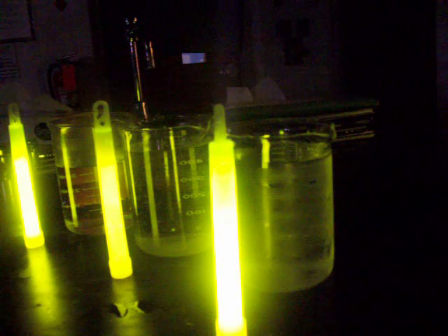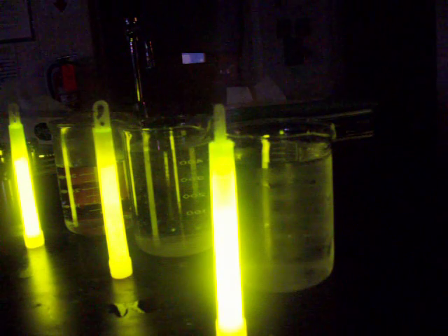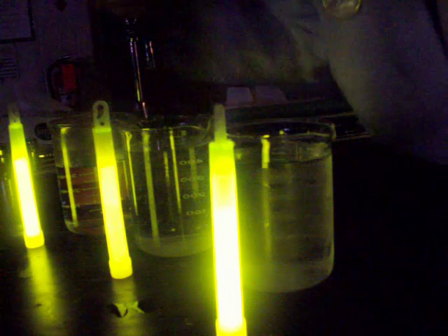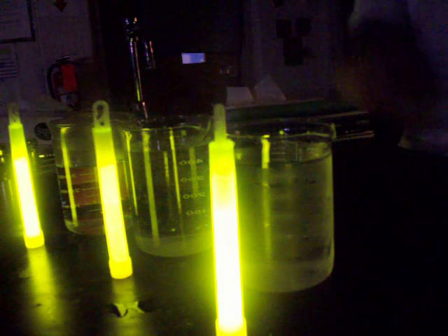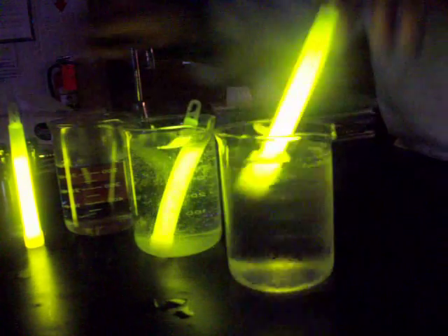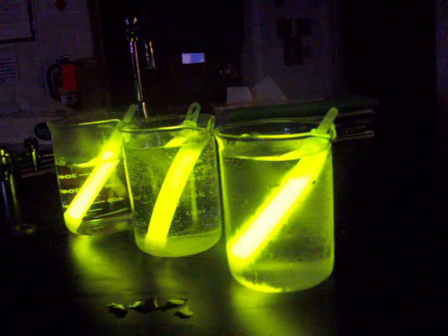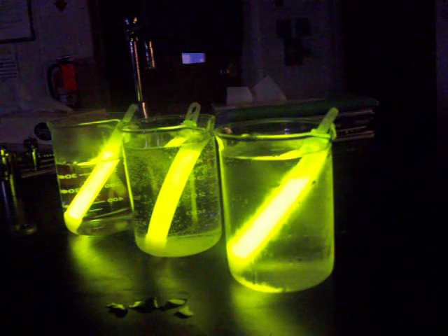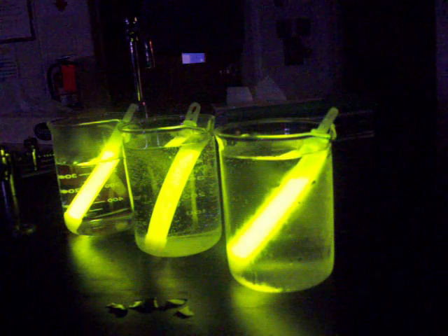So they're all glowing about the same brightness, as you can see, once the reaction starts. And what I'm going to do is plop each one of them into the different beakers. And I want you to just observe what happens as they sit in those beakers.